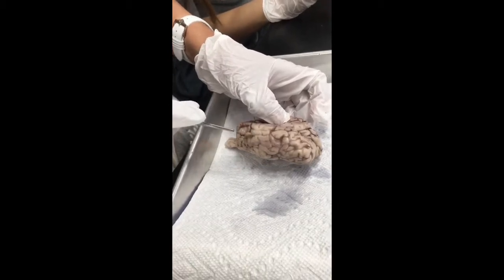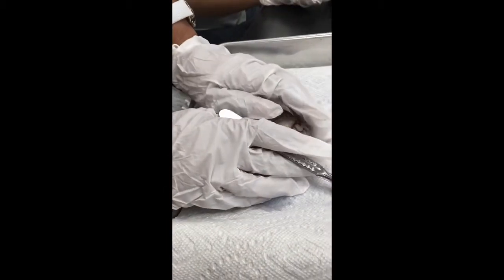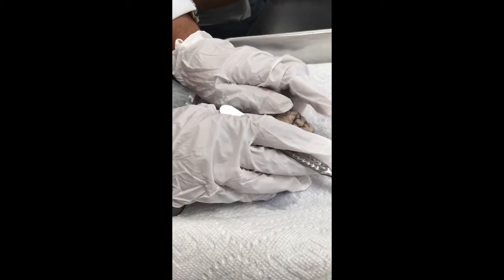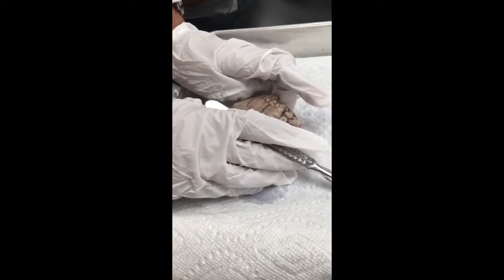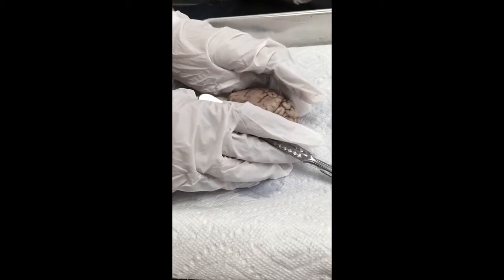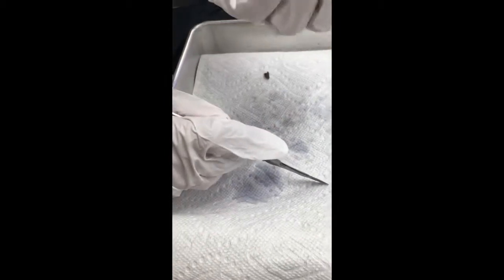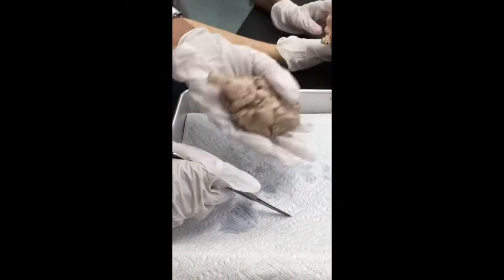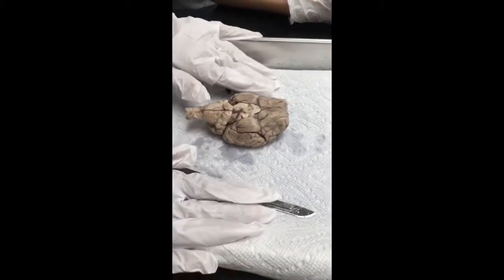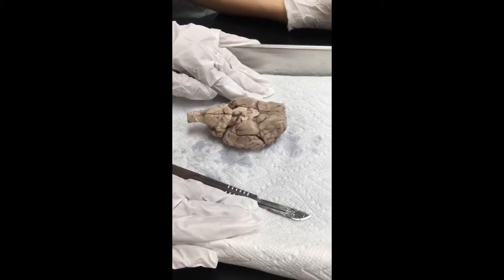Do you want us to cut into it, Mrs. Carver? Well, let's cover all the gross anatomy first. Okay. The cerebellum, the pons, the medulla oblongata. Cut under the temporal and the parietal and the frontal to see the insula, right? And then we are going to go in the back. Before I start cutting, I want to see the nerves. Then we cut to see the ventricles.